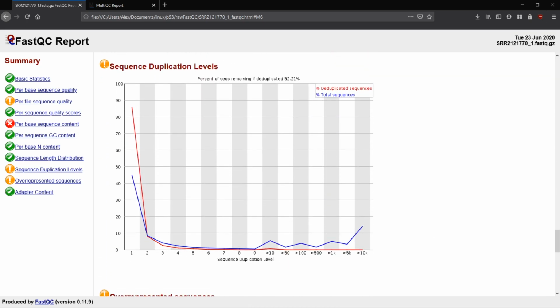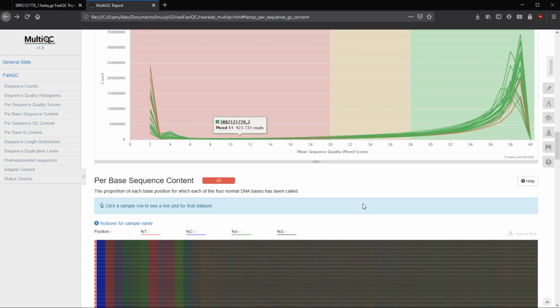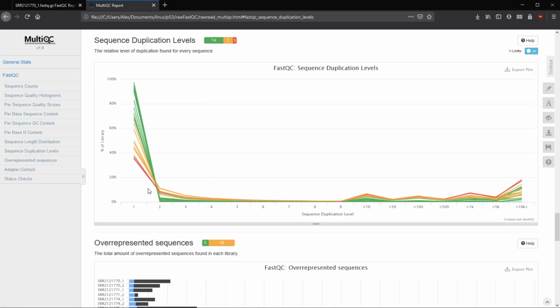Now sequence duplication levels. This is something that is a little confusing to me sometimes too, but this blue line is going to represent the percent of the total sequences that are duplicated however many times throughout the whole library that we have. That's going to be based on the bottom. So we have about 50% of our total sequences only have one. So that's pretty low. Let's see if we can go here and find that too. Yeah, we can see a lot of them are at 1, but the one that we have is somewhere in here.